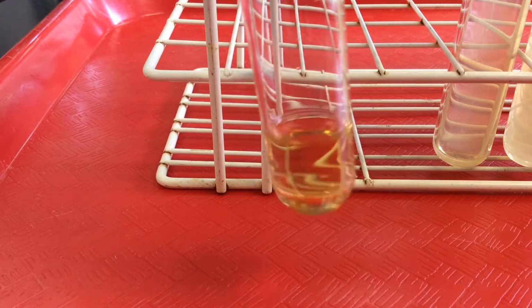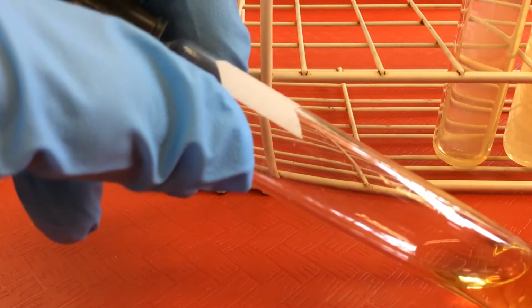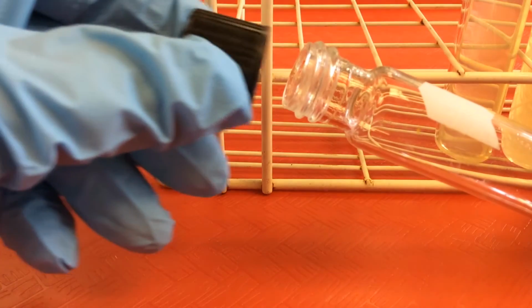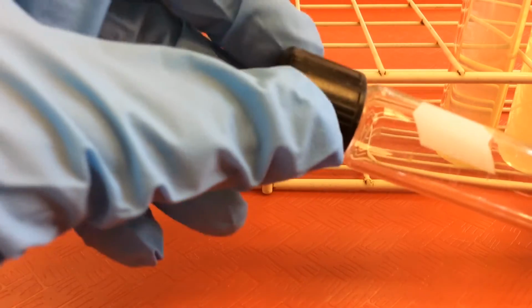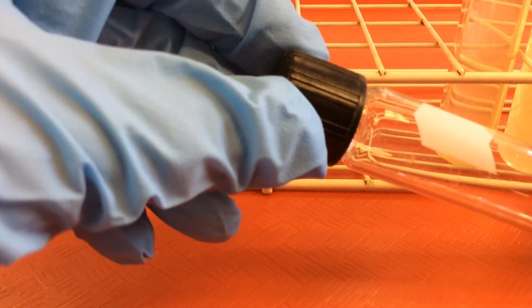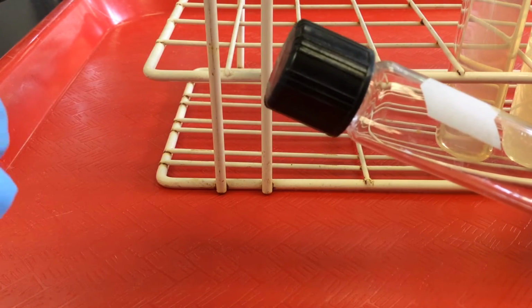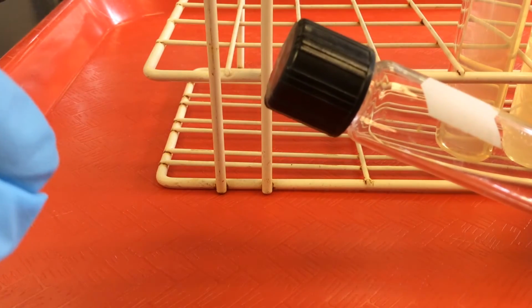Now, a huge safety item is that many of the tubes that we use to grow our microbes, as with this one, are screw cap tubes. You can see the threads here. When we put the caps on, after we've inoculated, transferred our microbes into the tube, we want to tighten and then barely loosen. This is crucial because we want to make sure that the gases produced while the microbes are growing don't build up within the tube.